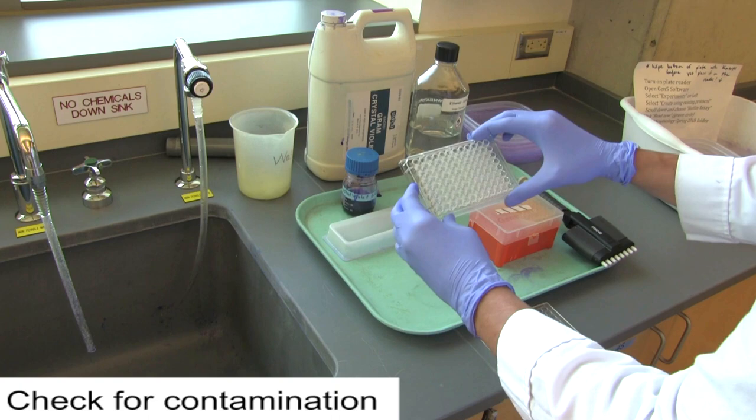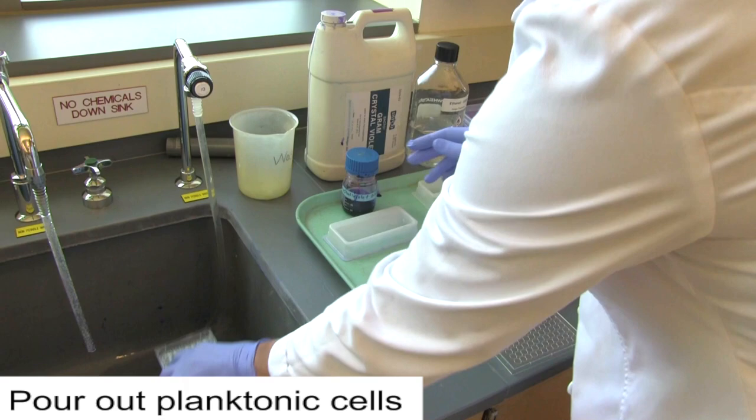First, look at your plate. You're checking for contamination. If any of the blank wells are cloudy, record these in your notebook.